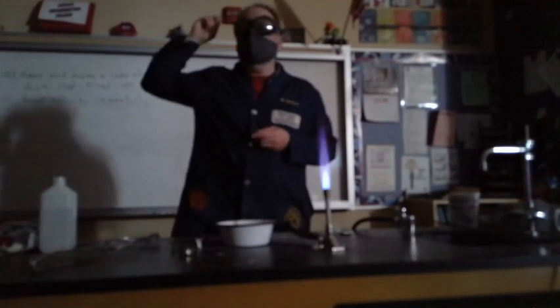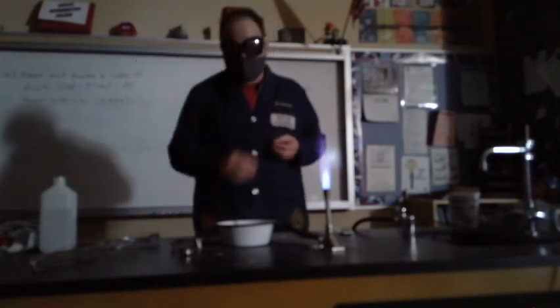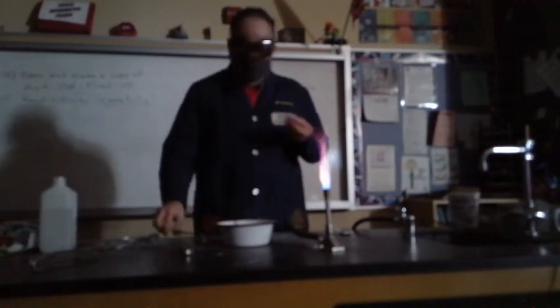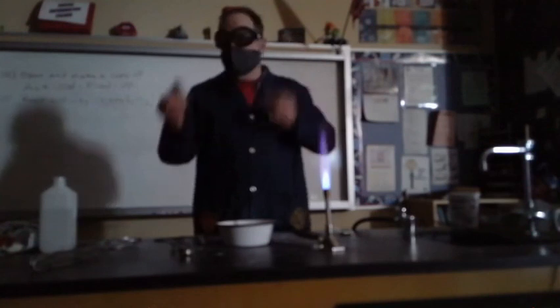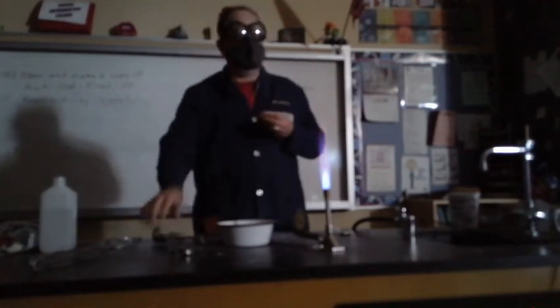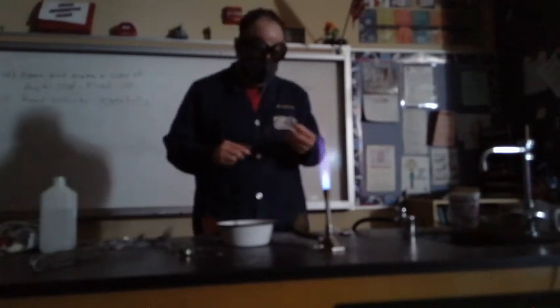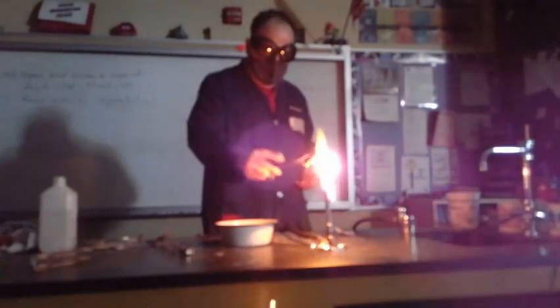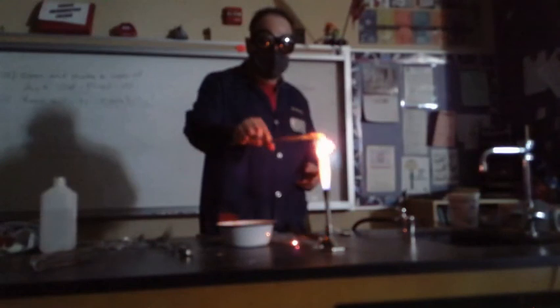Well, what about an element like iron, which is towards the middle of the periodic table? Remember, those guys aren't very reactive at all. Well, even iron will burn under the right circumstances. Here I have a piece of steel wool, like for scrubbing dishes and so forth. So I got some steel wool, again, a hot flame. And if you see the sparks flying off and so forth, that is it actually burning.